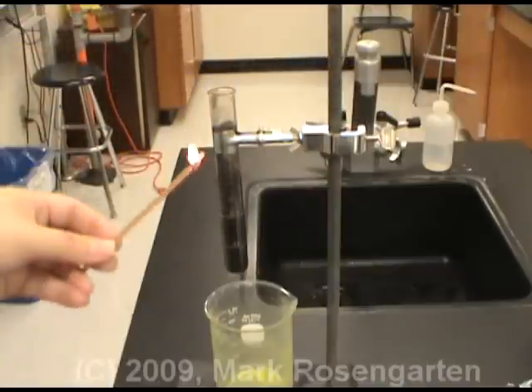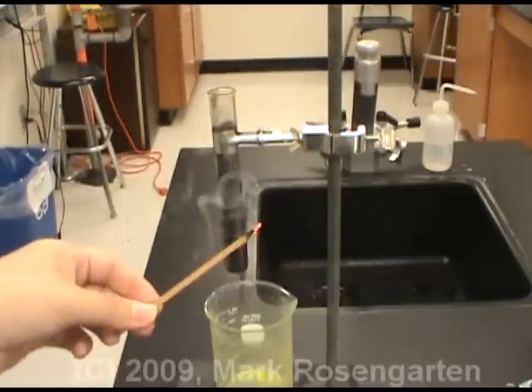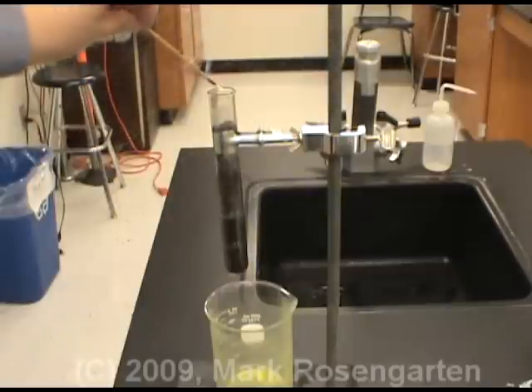The glowing splint test is a very handy test to see if there is oxygen in an environment.